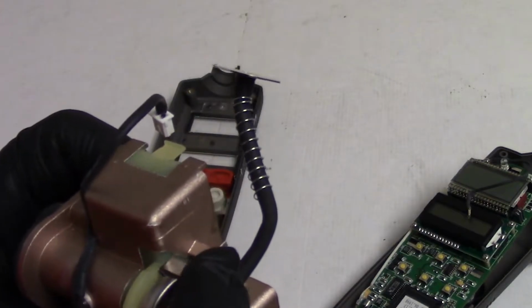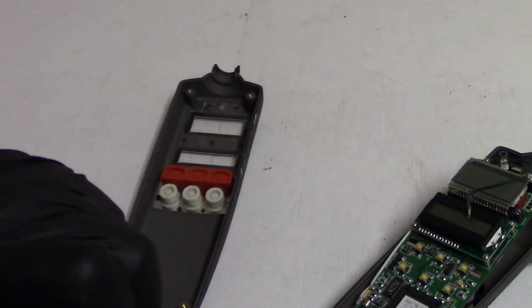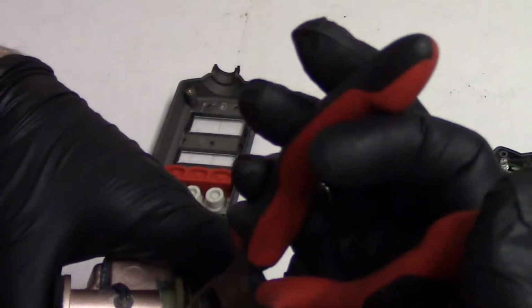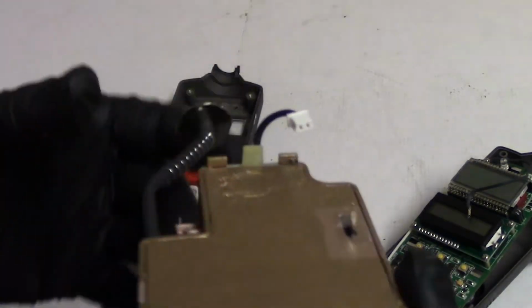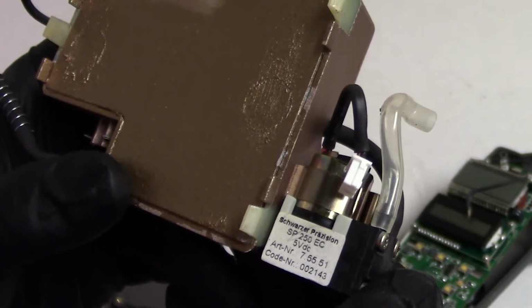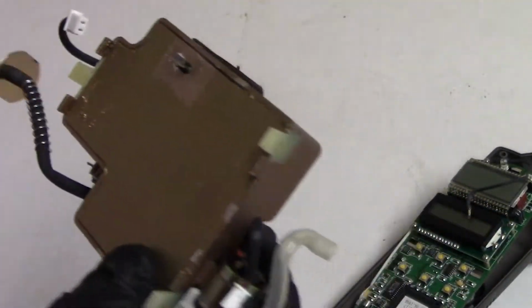These go here. Just trying to get this back together properly. Come on. There we are. Alright, so that is back together. So that could go back in. Here's our little pump. It is a Schwarzer Precision 5-volt. That's pretty good. That's a neat little pump. If I end up ever scrapping this thing down, that'd be a piece I'd keep.